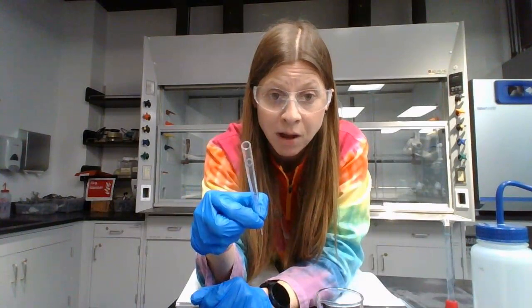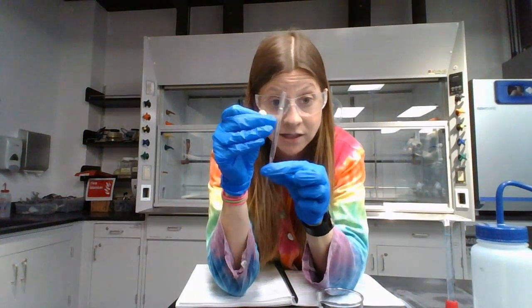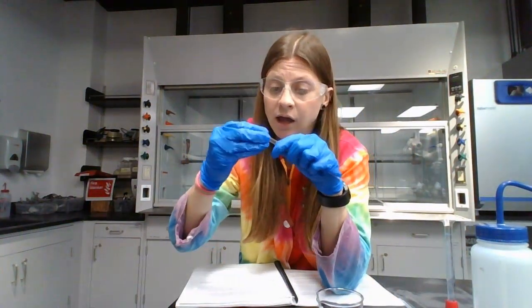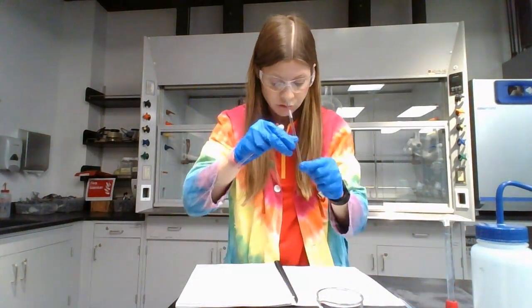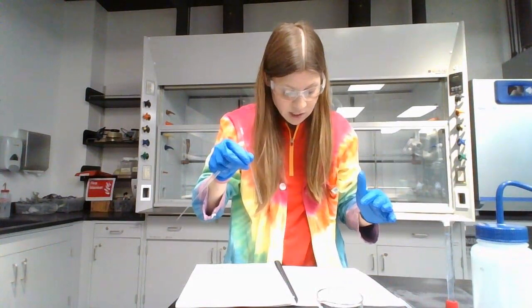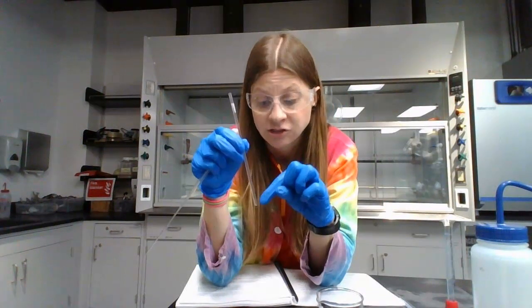But they do not come with pipette bulbs at the end. So we have to use bulbs that are made for these pasteur pipettes. So you're going to add the bulb to the top of the pasteur pipette. And then you are going to, well, I guess before we do this, first measure 4 centimeters from the bottom of the NMR tube. Starting at the bottom, measure 4 centimeters up and make a line on your NMR tube. That's how full we need to make the NMR tube of liquid. I'm guessing eyeballing 4 centimeters isn't something you can do if you're not terribly familiar with the metric system. So grab a ruler, measure 4 centimeters up, and mark it.